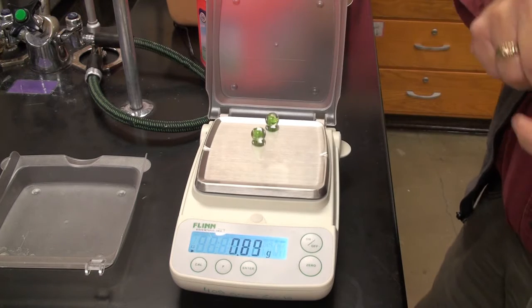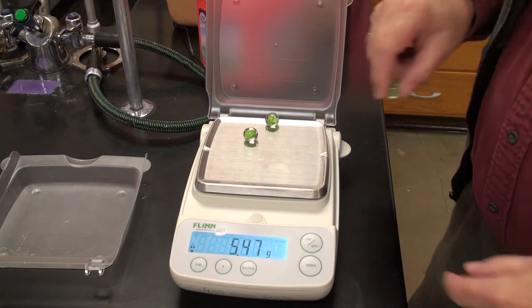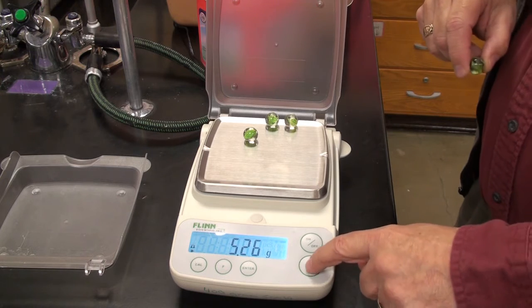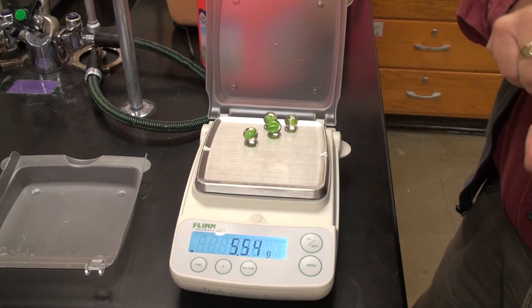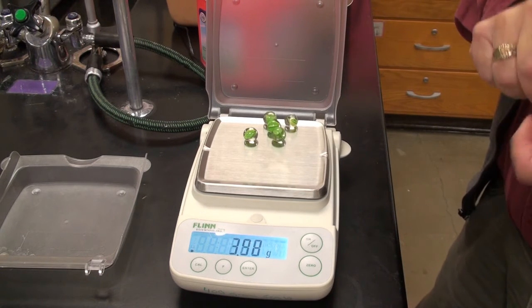Zero it. Here's the second one. Zero it. Here's the third one. Zero it. Here's the fourth one. Zero it. Here's the fifth one.